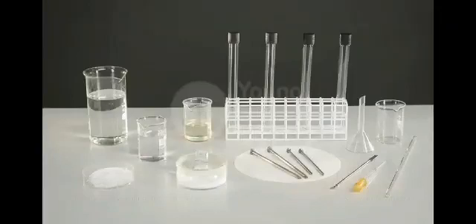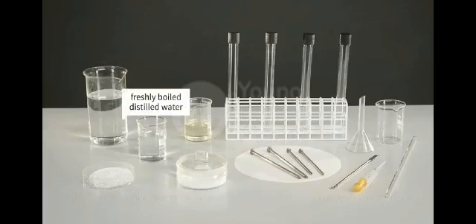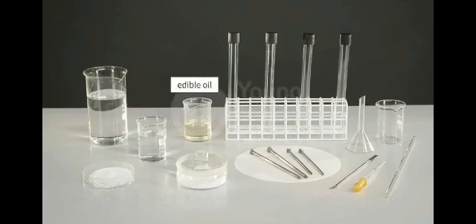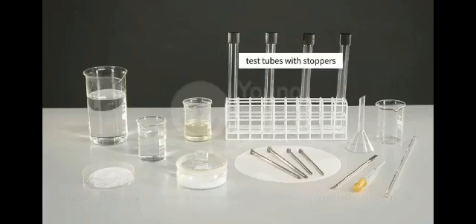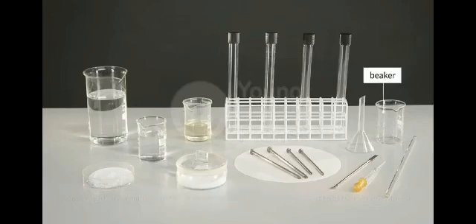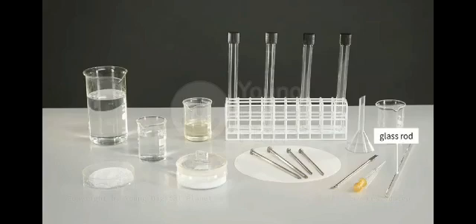External factors on rusting. We will need the following items for the experiment: nails containing iron, distilled water, sodium chloride, freshly boiled distilled water, edible oil, anhydrous calcium chloride, and test tubes with stoppers, a beaker, a funnel, a pipette, a spatula spoon, and a glass rod.